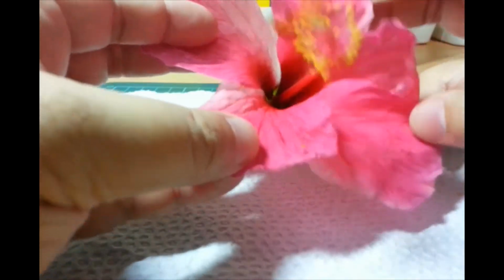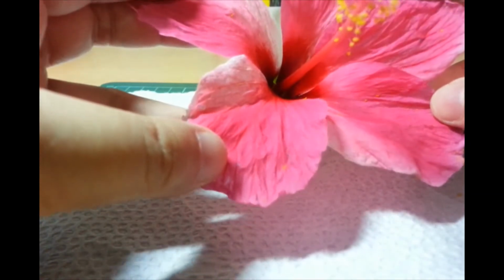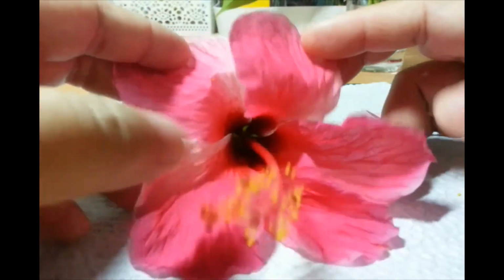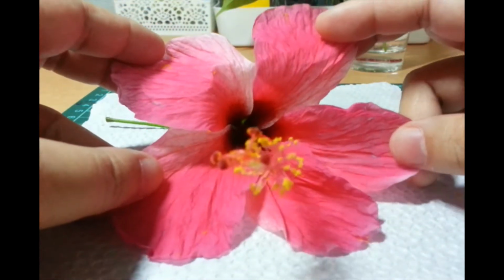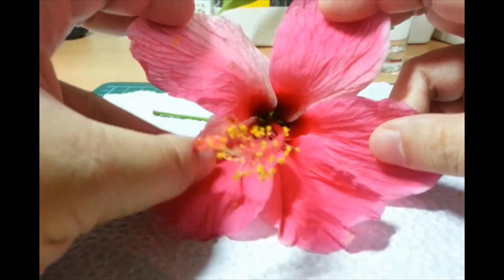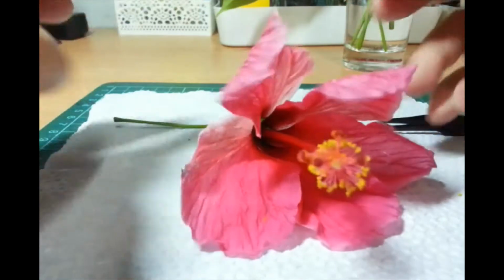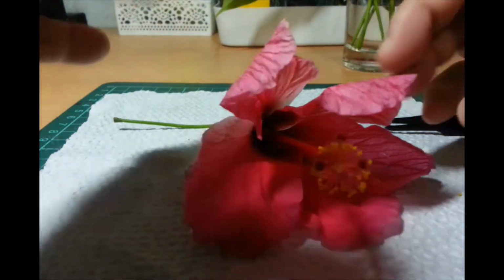It's similar to the structure of the leaves, where you have veins, but of course the coloring is very different. It's bright. It sets it apart from the rest of the plant. So when you have pollinators, that's where they go, because they see it brightly colored. And they know, of course, through learned behavior, that there will be nectar inside. So don't be surprised if, while we dissect, we encounter some pollinators.